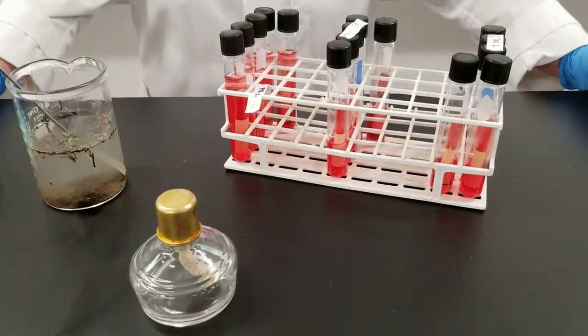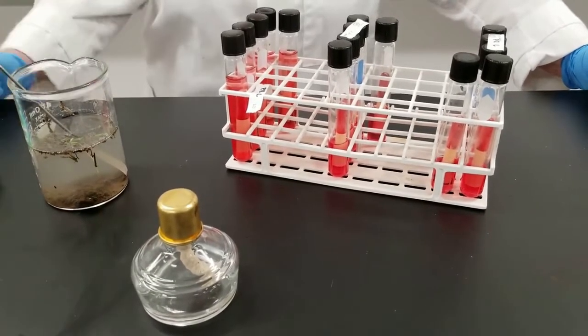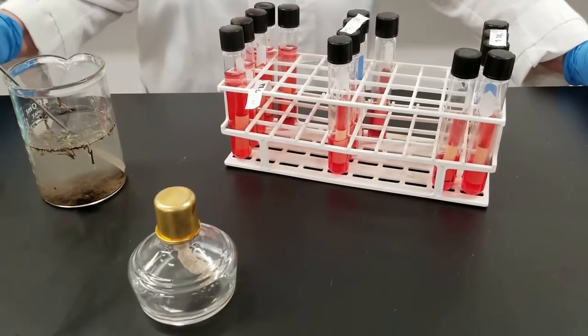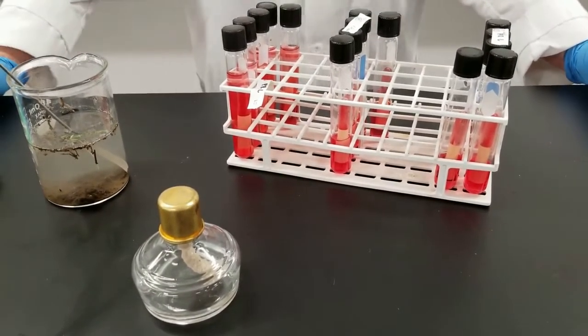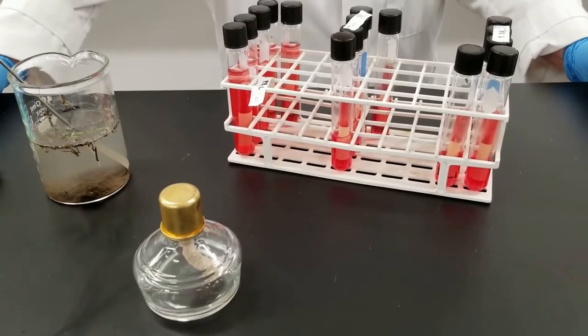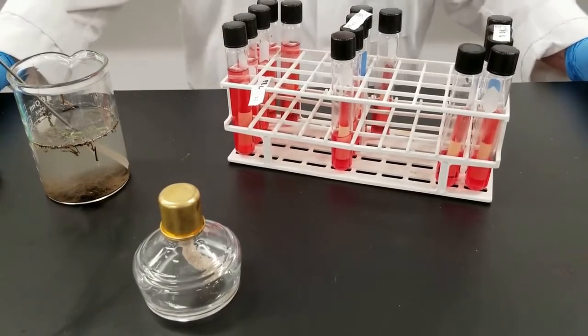One thing that you're going to have to do is determine how many bacteria are in the water sample. So per milliliter, what's the concentration? Usually you're looking at the bacteria. There's numerous ways of doing this. There's a filtration method. Another method is called the MPN, the most probable number. And that's what we have set up here.